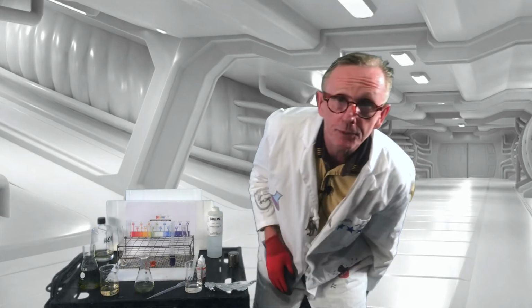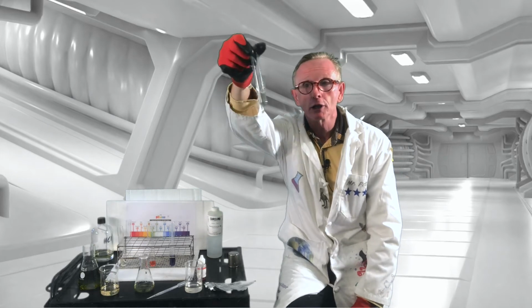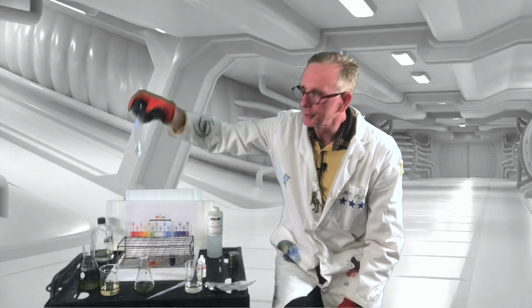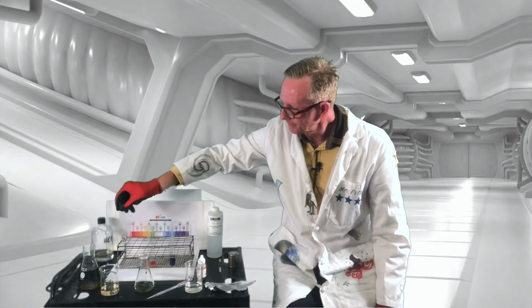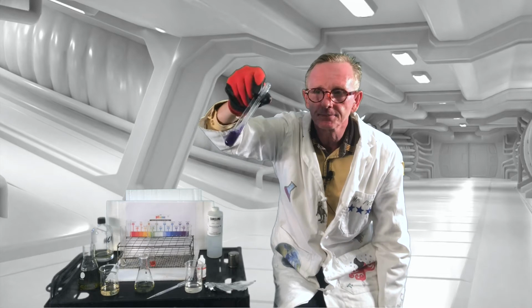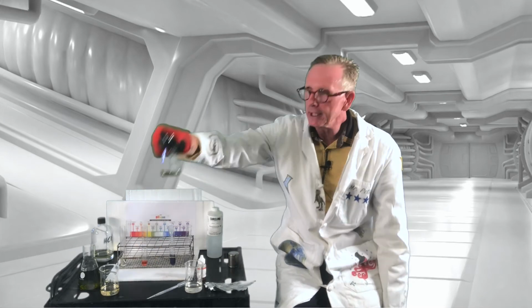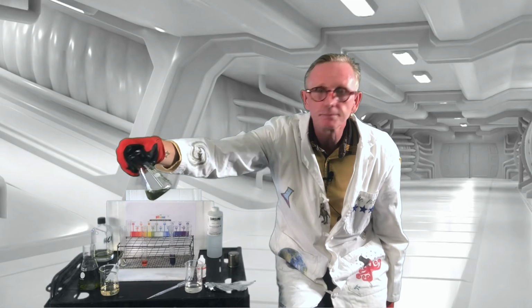At this point, you should have enough data. You can see what happens to aluminum foil in sodium hydroxide. We can see what happens to aluminum foil in hydrochloric acid. We could determine the pH of each, and ultimately what occurred when we mixed them together.